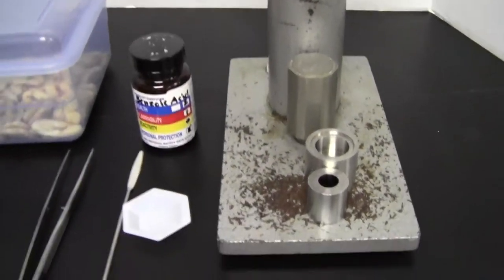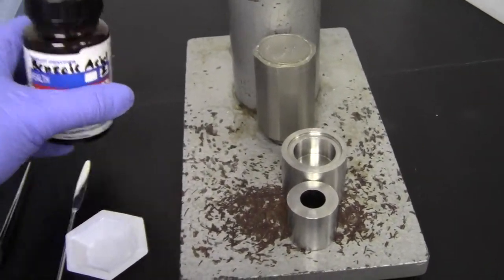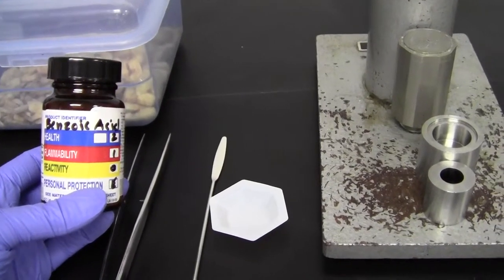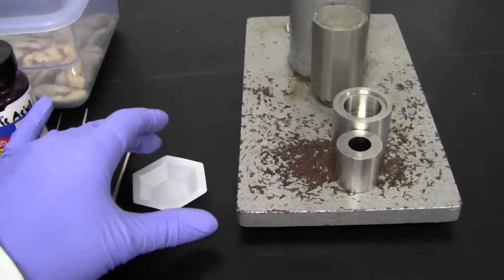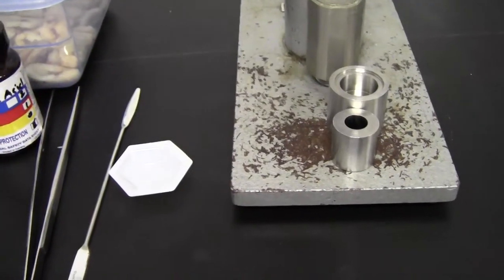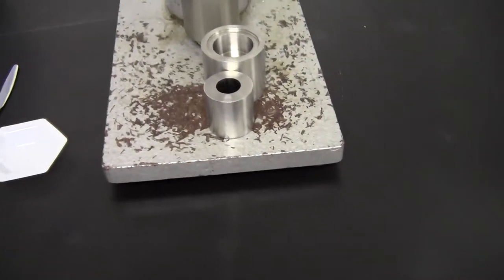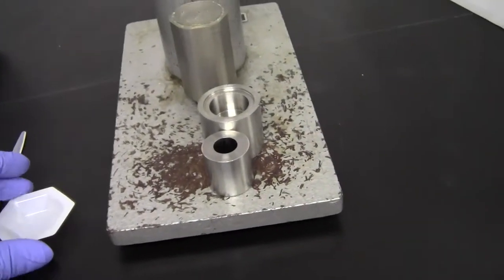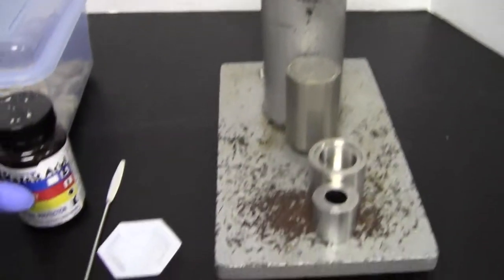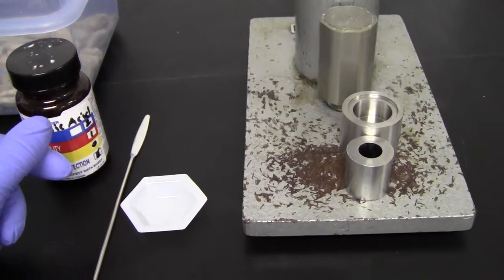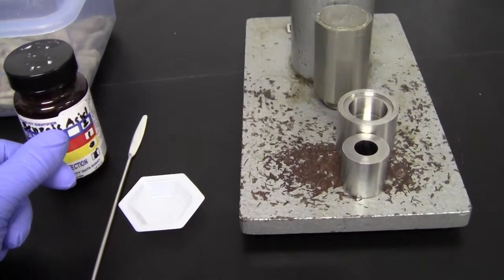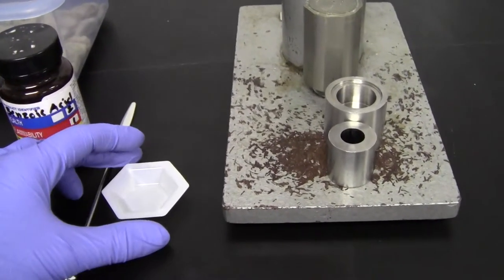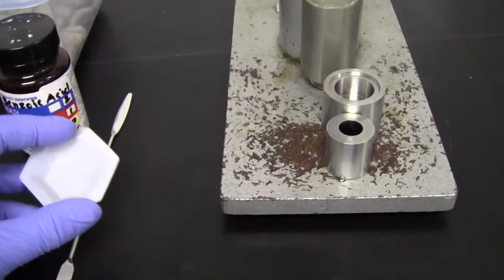So let's just have a closer look here. The first thing you want to do is weigh out the required amount of benzoic acid in the balance room, and you'll use a nice clean spatula and use a plastic weigh boat for that. And just weigh out the powder. You'll notice in your experimental procedure that there is a minimum value and a maximum value. So make sure, most importantly, that you don't exceed the maximum value. So go to the balance and get your benzoic acid.